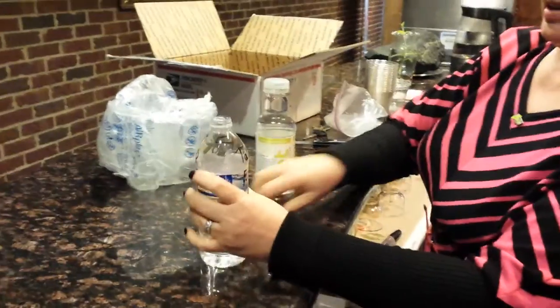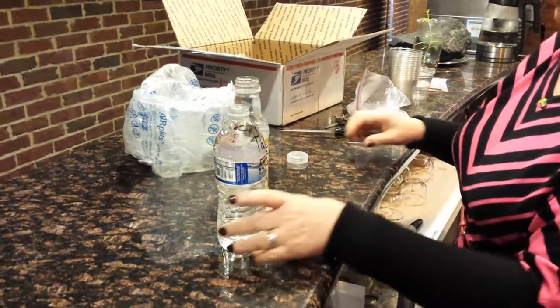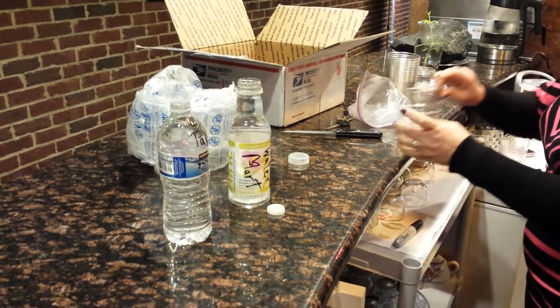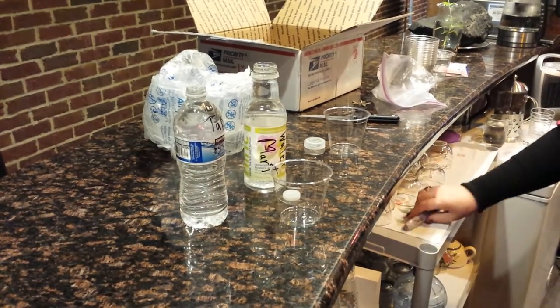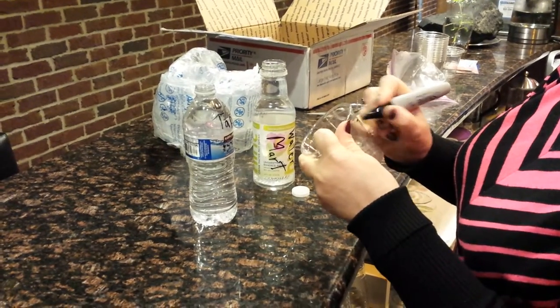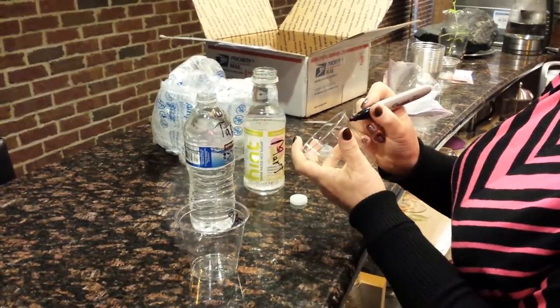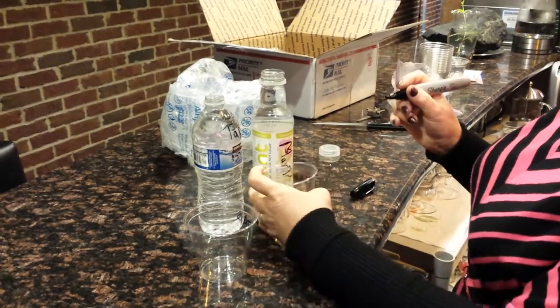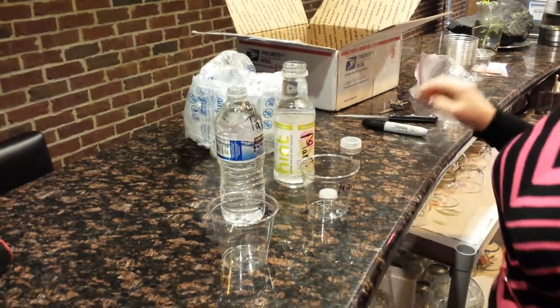All right, we're back — we're not going to pause, we're just going to do our thing here. I haven't looked up the water report for Mesa, Arizona yet. That's the water mart — that's the water he buys with the five-gallon container. He mentioned their water is not that good.